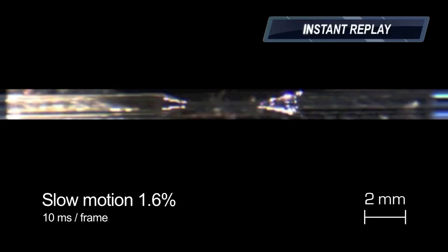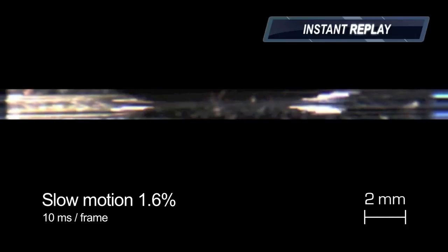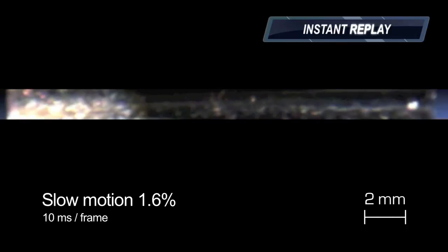Individual frames can be visually separated now. While the glowing of the glass cannot be seen as clearly, the glass itself is better to see under the brighter illumination. But even with a higher frame rate, the second pull only covers 3-4 frames.